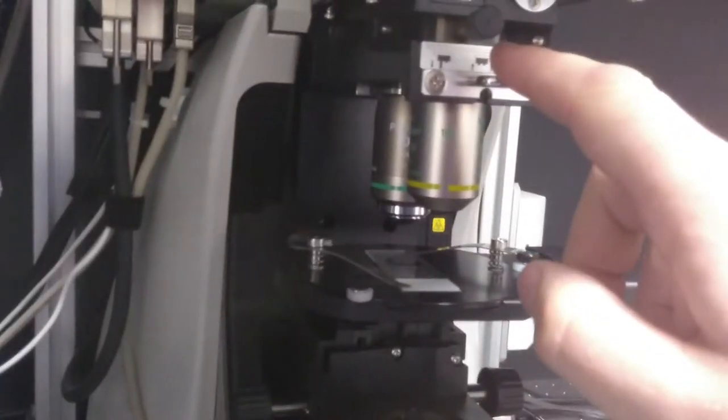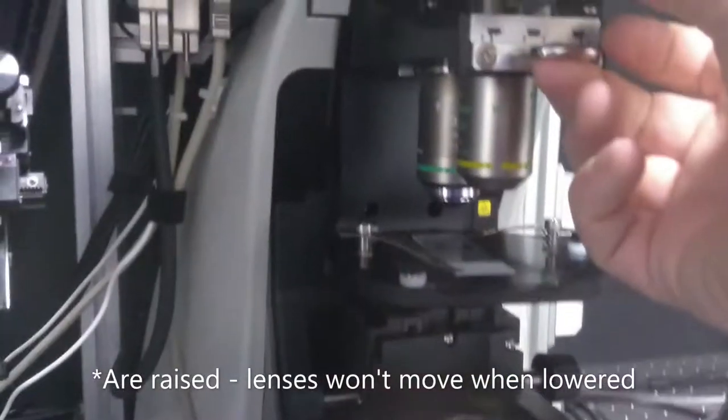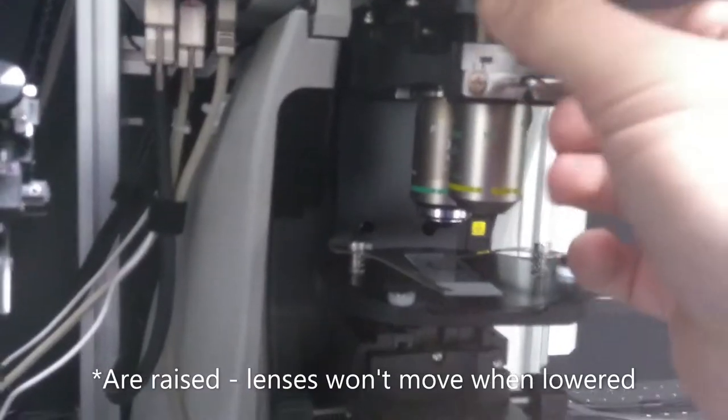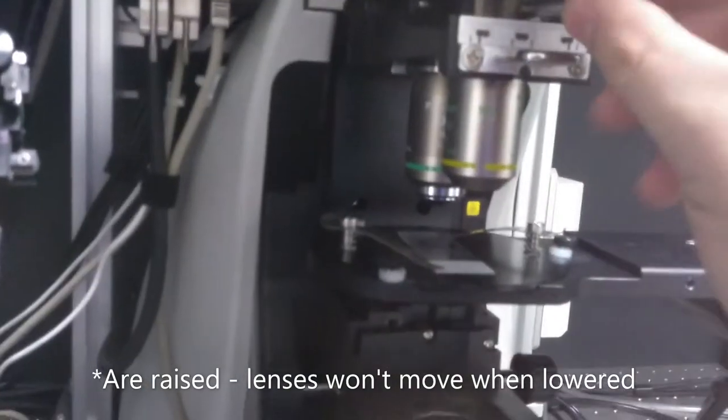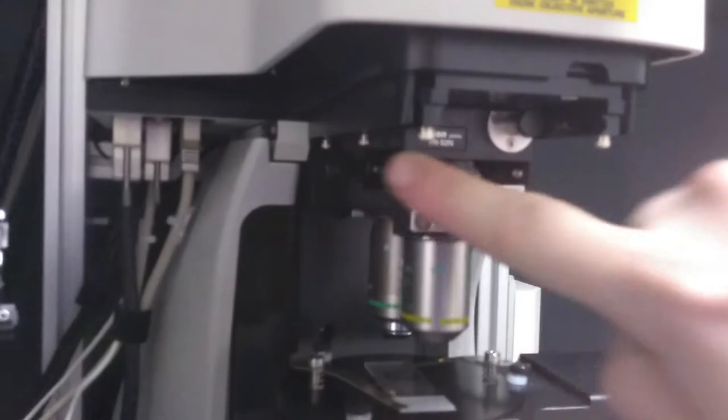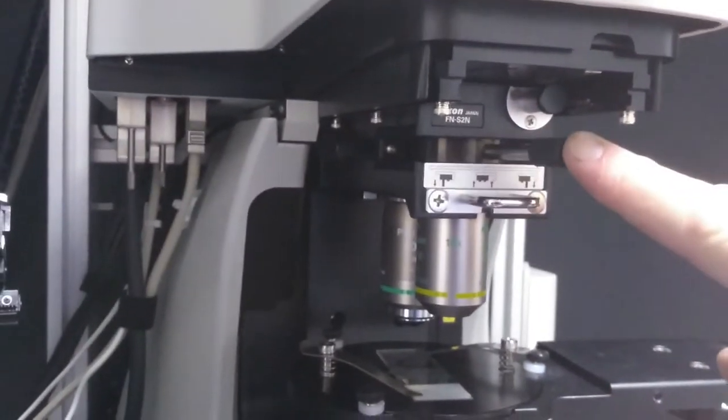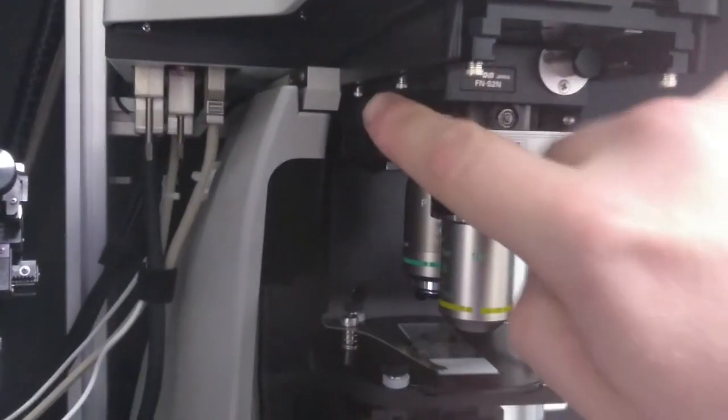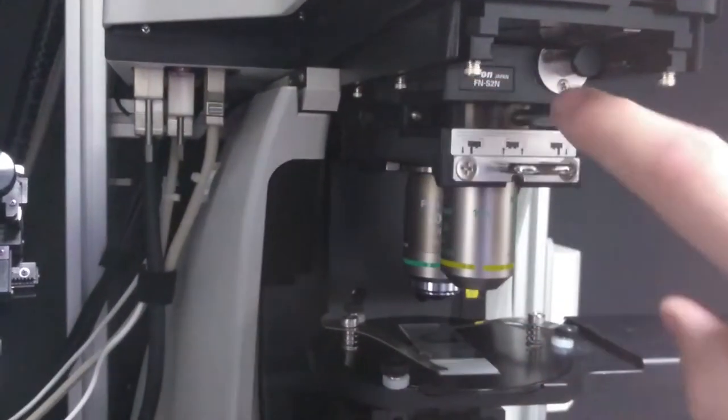The first thing you need to do is decide which lens you're going to use. You can change the position of the lenses when the lenses are not raised, so there is an arm on the front of the unit here which will allow you to drop your lens into position.